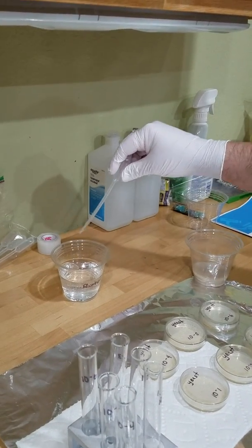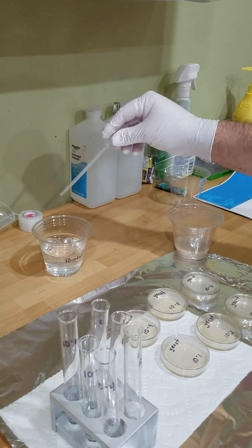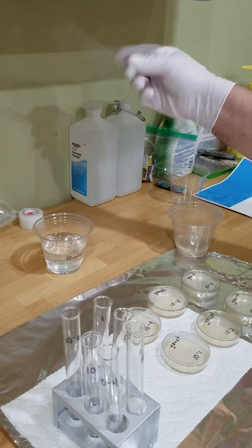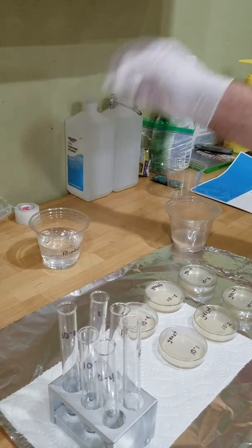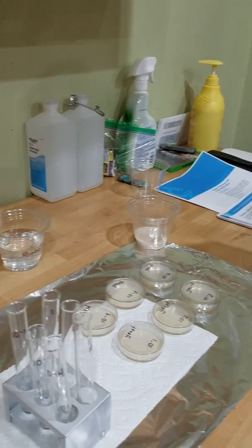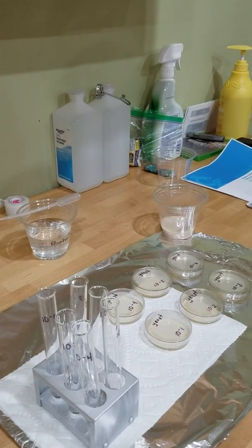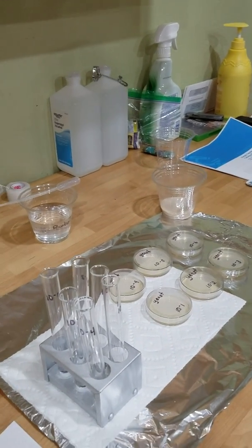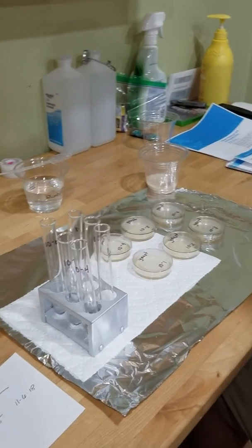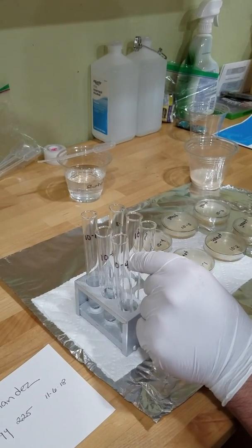And we're going to go ahead and use that. So let me make sure we got no alcohol in this. This is the only downside to this, because if there is, it's going to throw off this whole experiment. Okay, so I'll put it here for 1 second and let it air dry. So we have everything here, test tubes. So we're going to add 1/4 ml of yeast into the initial test tube number 1.